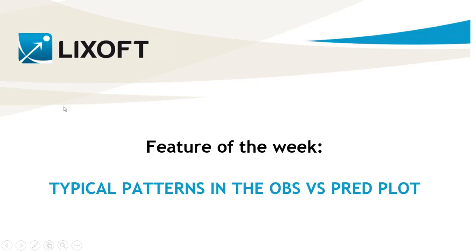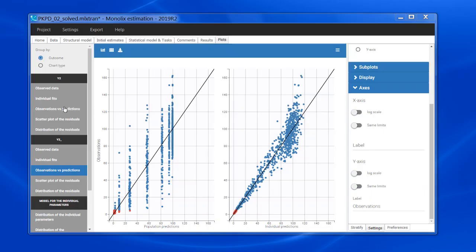Today I will show you typical patterns which can be observed in the Obs vs. Pred plot and how to interpret them. The Obs vs. Pred plot is useful to diagnose misspecification of the structural model.